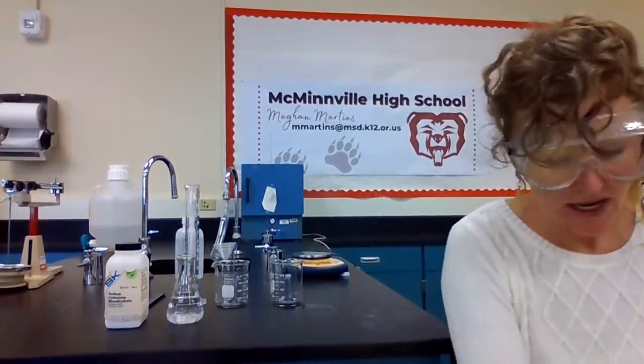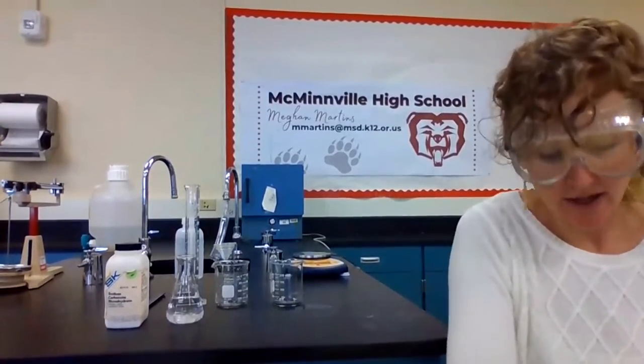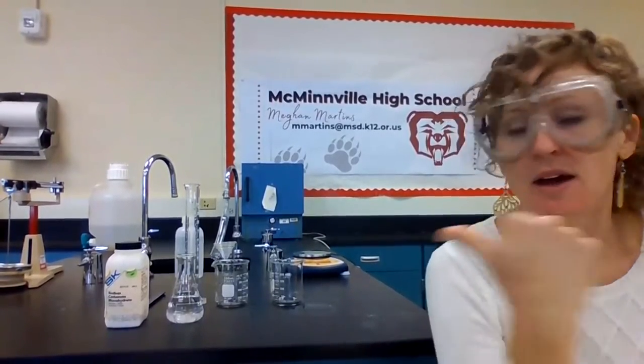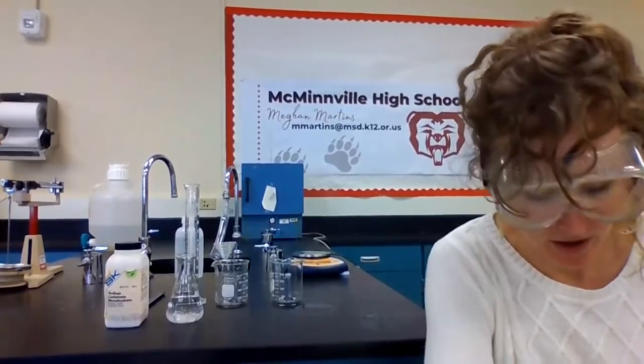All right, welcome to the investigation. We are going to use gravimetric analysis to analyze a sample of tap water to find out how much calcium is in the tap water. So I did my calculations like we talked about, using the greatest amount of calcium that our research paper listed. They found in bottled water, tap water, and spring water, which was 208 milligrams per liter.